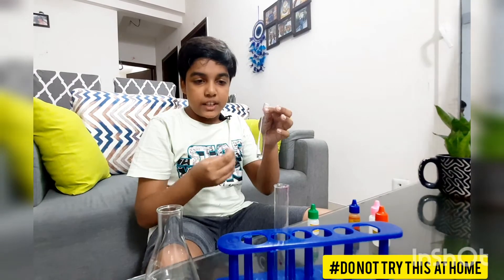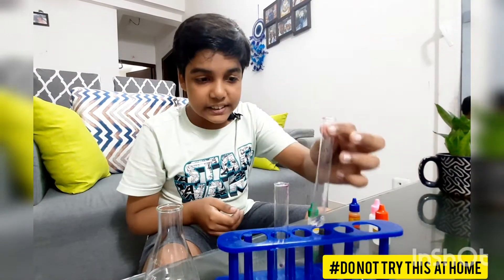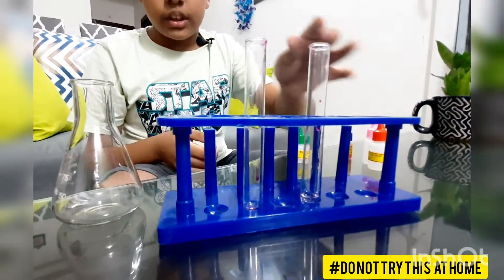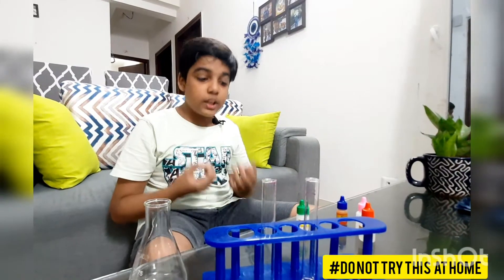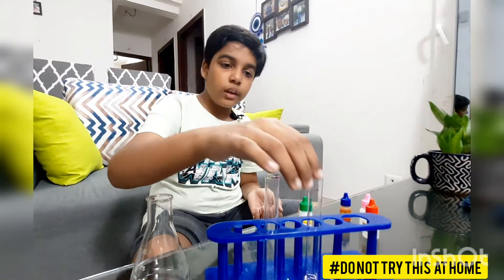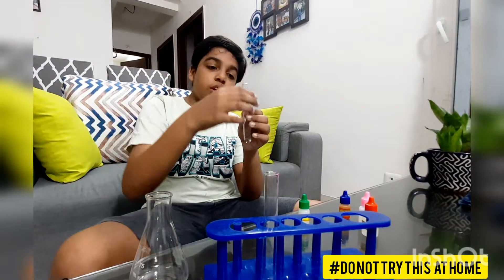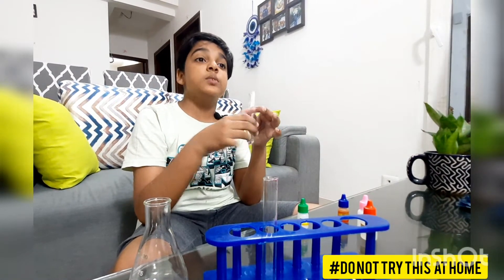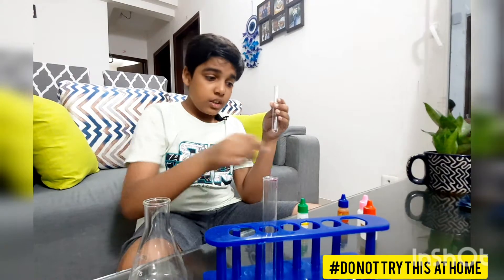Why has it turned colorless? Because neutralization has taken place. What happens in neutralization is that an acid and a base neutralize the effect of each other. Now I want to have a more precise way of knowing which solution has a greater quantity.